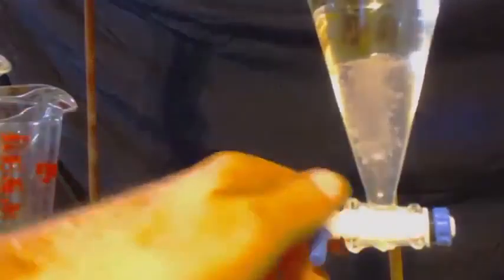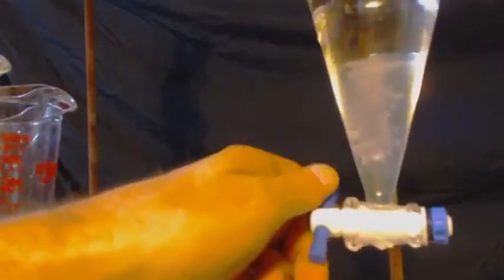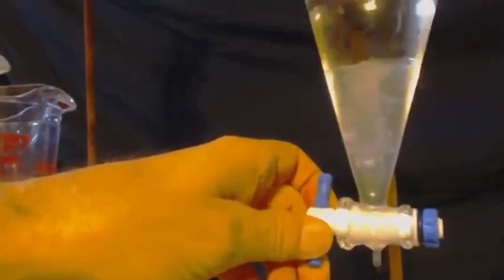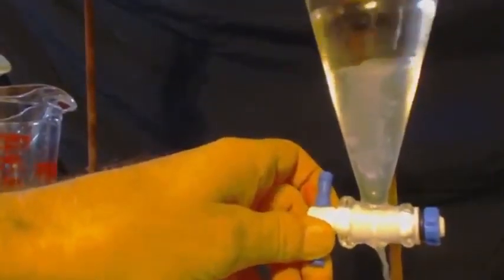They use that as a propellant. That's what shoots all the liquids out. Now, MSDS didn't say anything about solids, but you can see plainly here that there are solids in that bottom layer. I don't know what the deal is because of that, but at least they're in the bottom layer where we're going to get rid of it, so it doesn't matter.